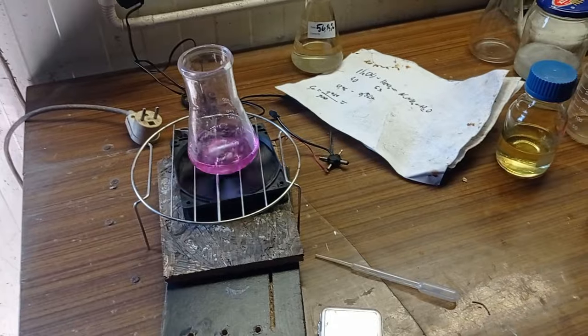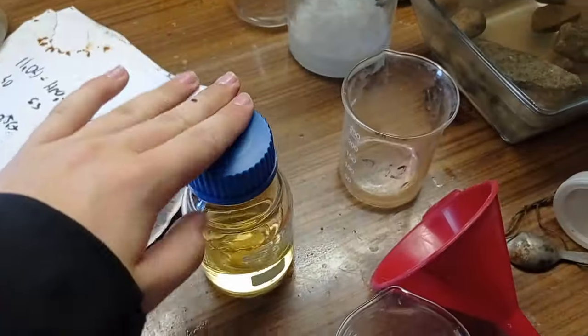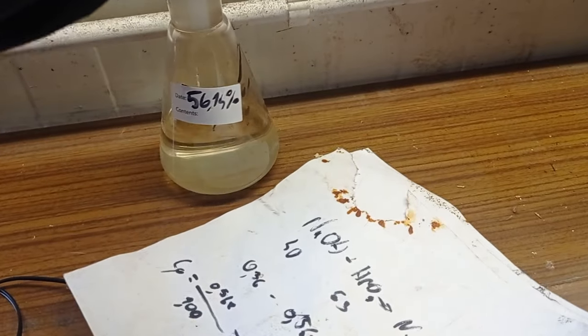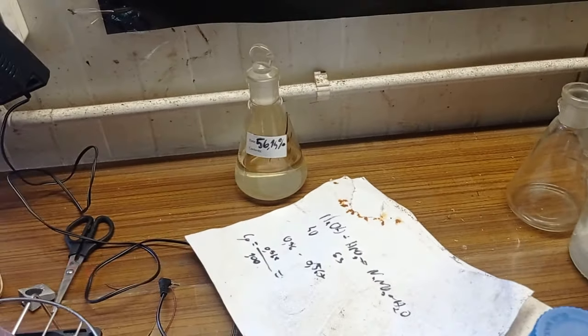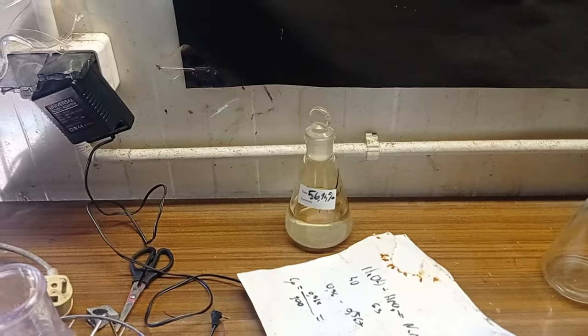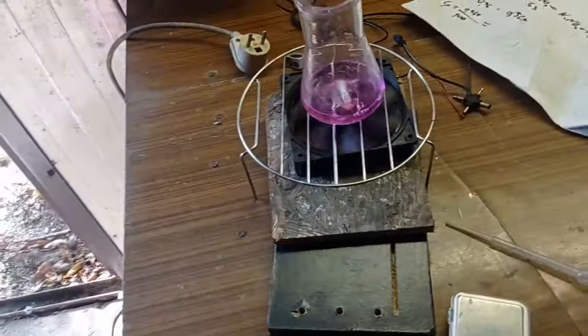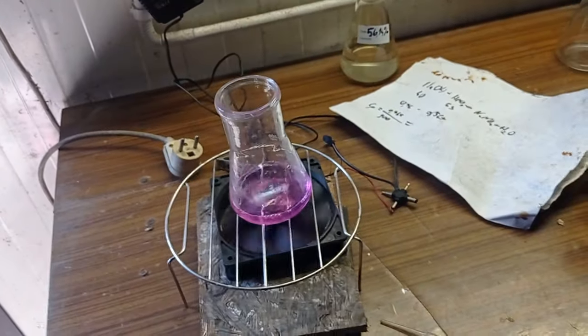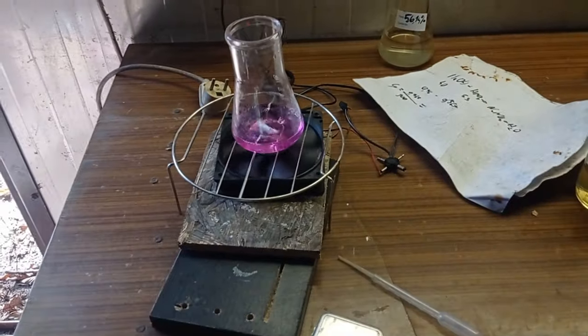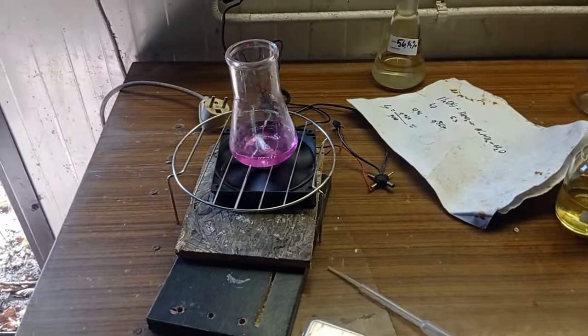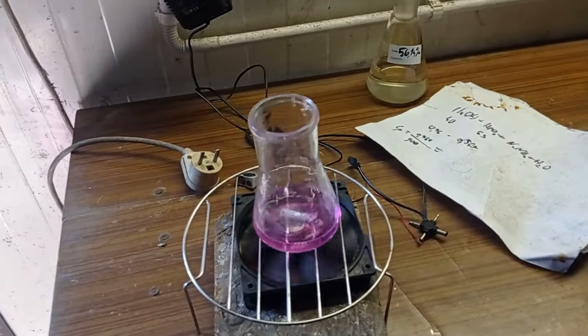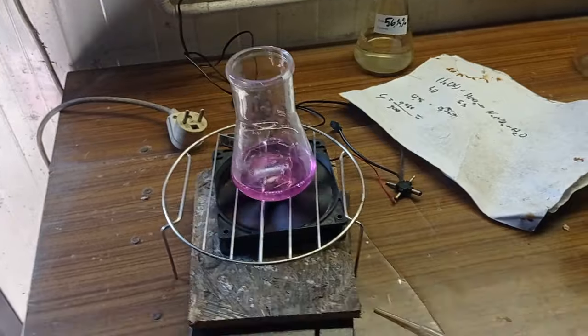So I just titrated the second portion. The first portion has a concentration of 55-56%, but this higher concentration portion has 73.5%. We have a problem here because the maximal azeotropic concentration is 68%, so it's impossible.